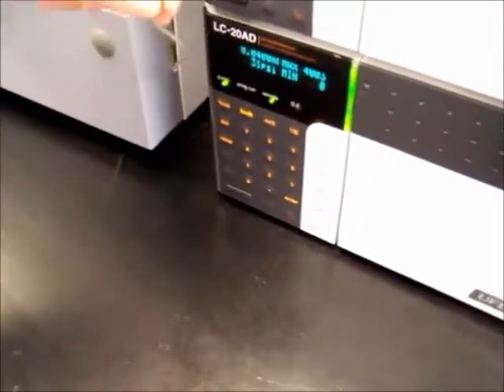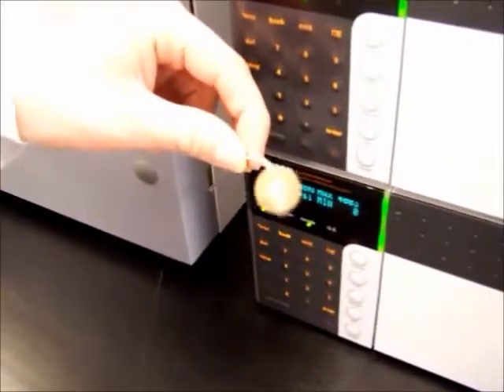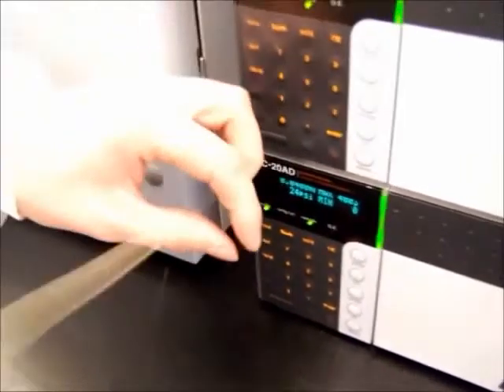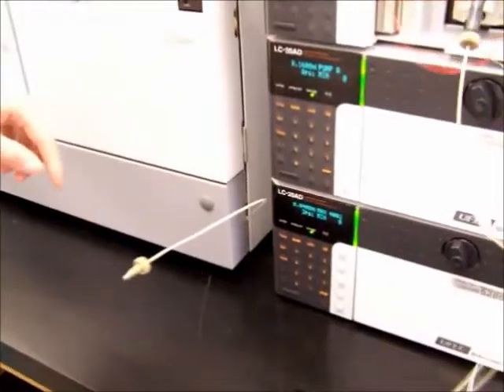Now, a good way to test, this is a good time to demonstrate it, a good time to test whether or not there's a clog in your line, or if you have a crimped tube during cutting, is to turn on the pumps. You notice a little bit of fluid coming through right there. So a little bit of fluid's coming through, you know that your line is clear and that your hose isn't crimped at any point. So we're going to shut that off now. I'm pushing the pump off button. Pushing the pump button again.